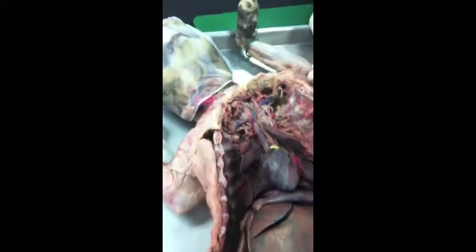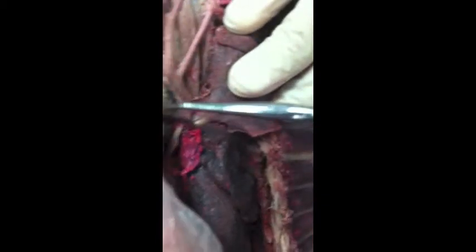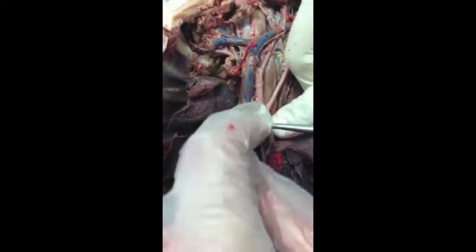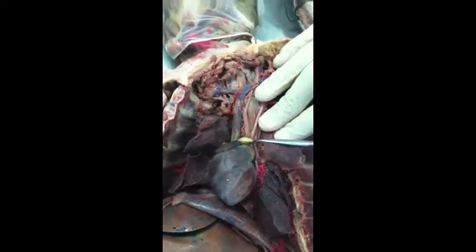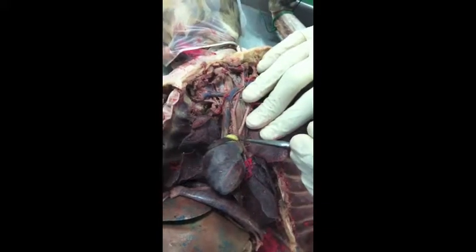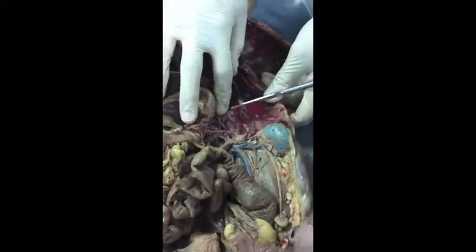Where's the pulmonary trunk? I think she pointed to it right here. So it's not that little white cap. It's this thing right here. What is that? A fatty heart? It's a little fat here on top of the aorta. Yeah. High cholesterol or something like that? It's from high cholesterol.